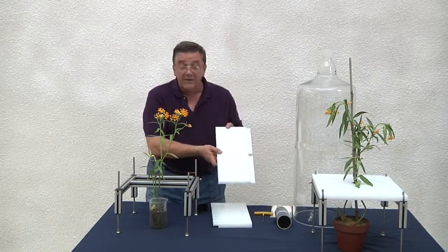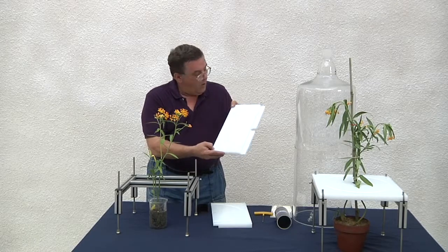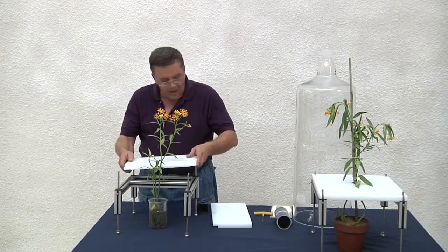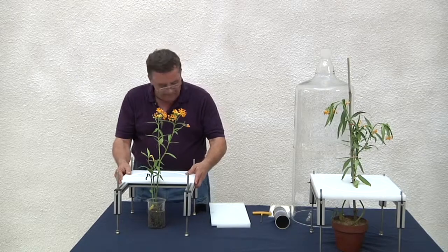Then we set the rear of our guillotine into place. The holes here lining up and locking in the rear of our guillotine.